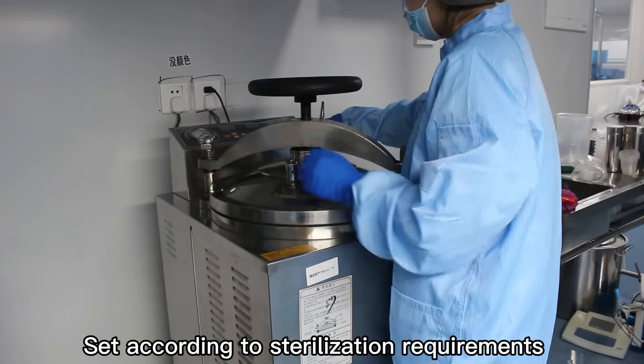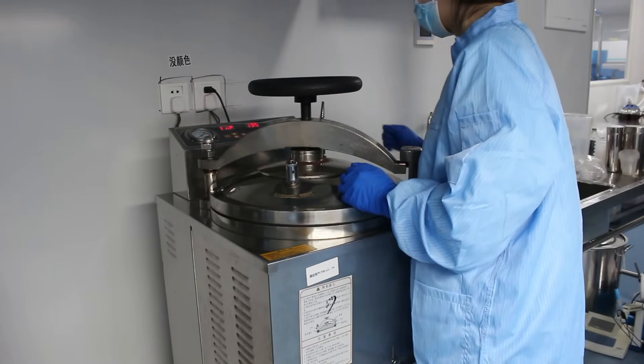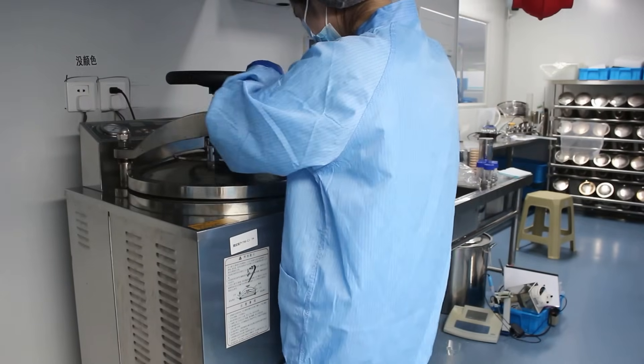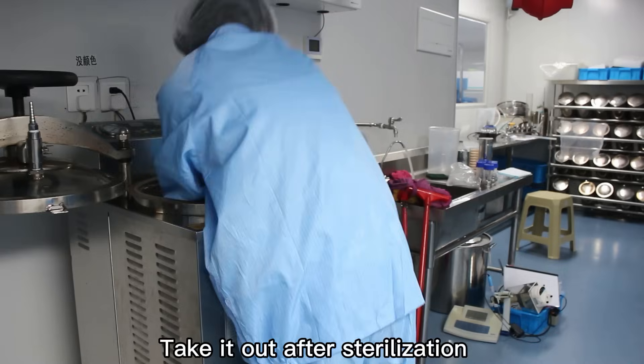Set according to sterilization requirements. Take it out after sterilization.